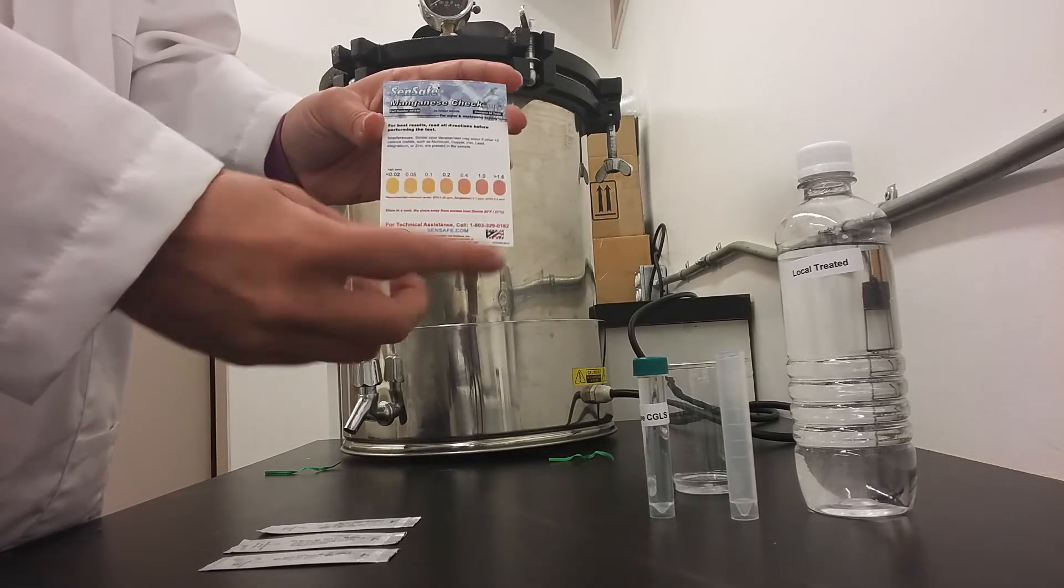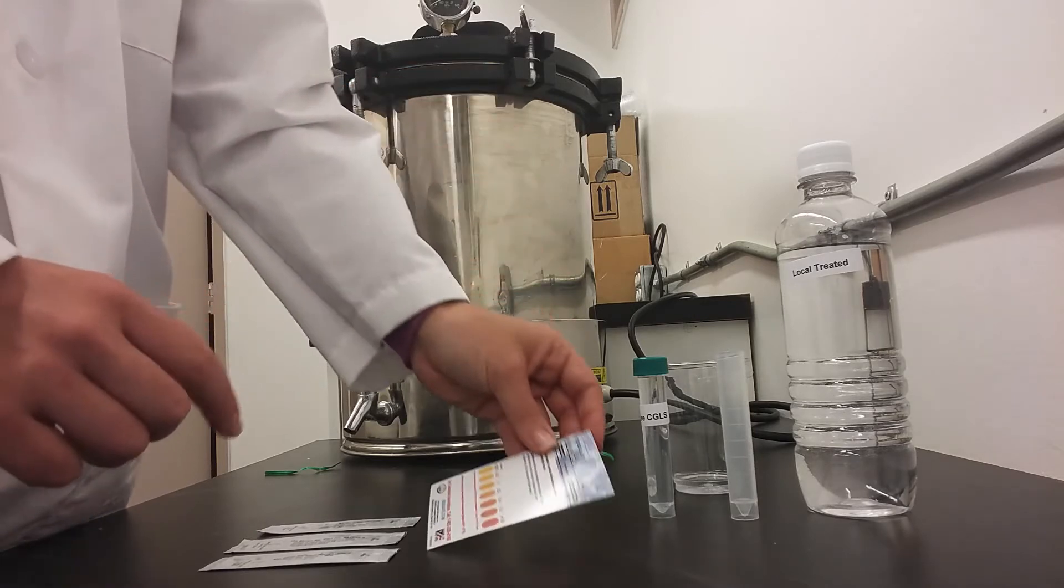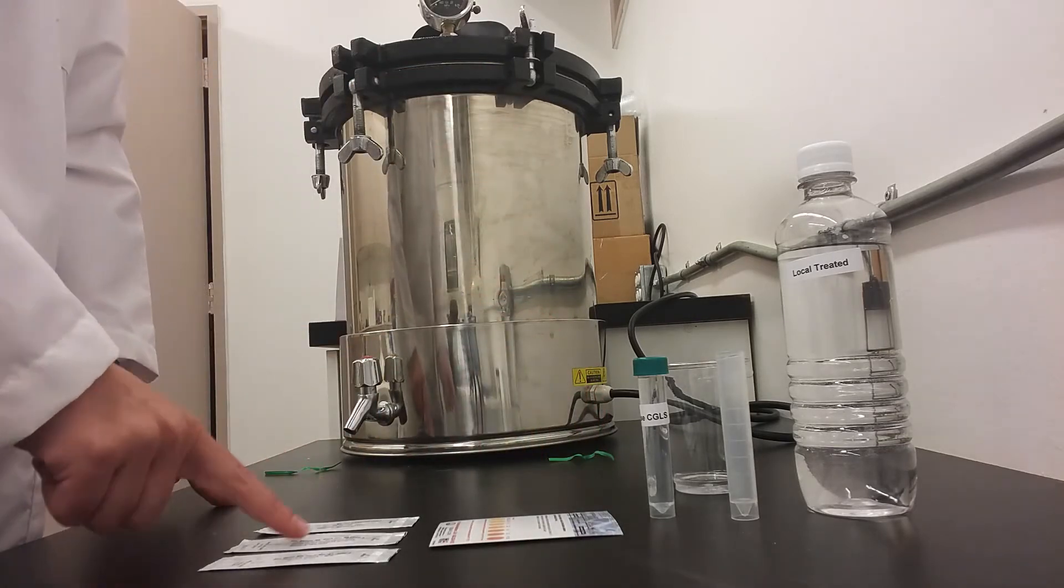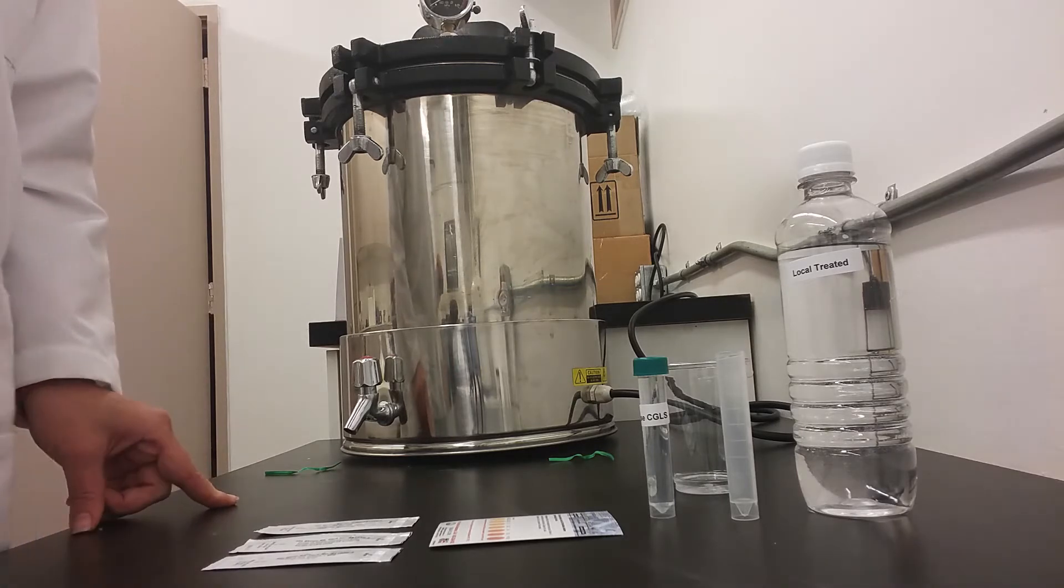You will also need the color chart and three different manganese test strips that we will use in succession to test the water.